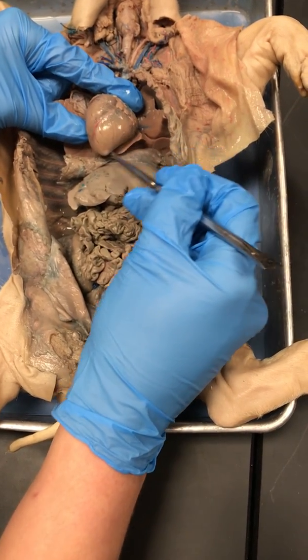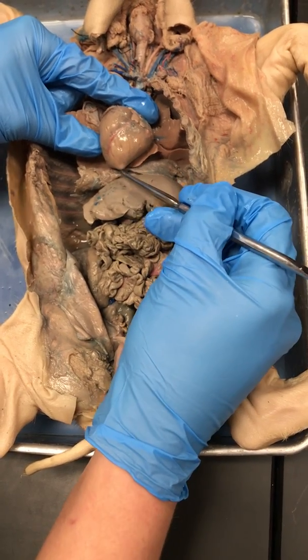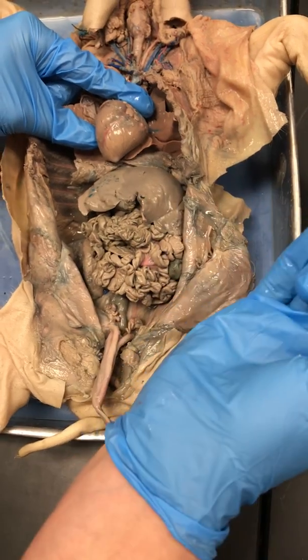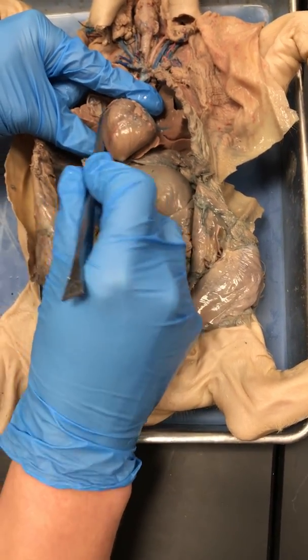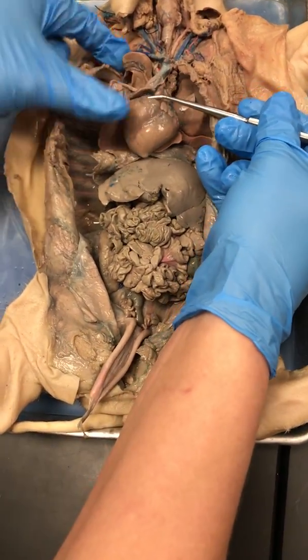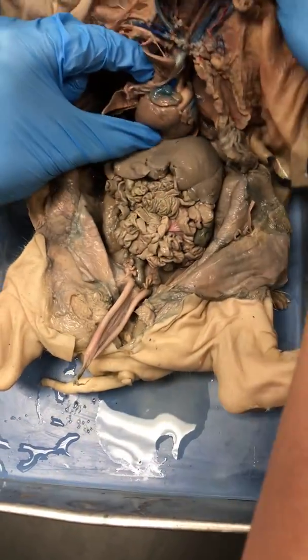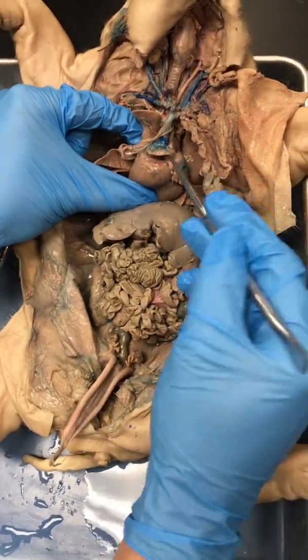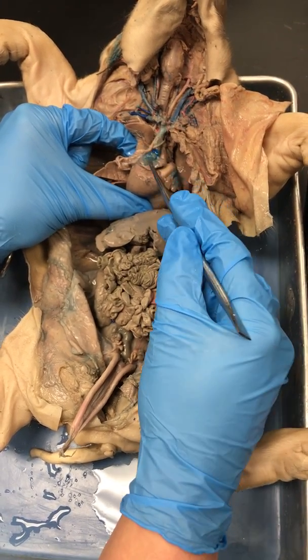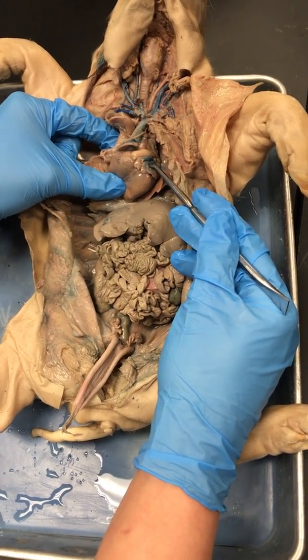You'll notice this is one section. This is the left ventricle, all right? It always takes up the very most bottom part of the heart. The next part we want to pay attention to is its compadre right over here, the right ventricle. And then if we're coming up above what looks like a crown right here, I'll tilt this pig up where you can see it a little bit better. This area right here is going to be your right atrium. And then right next to it would be your left atrium.